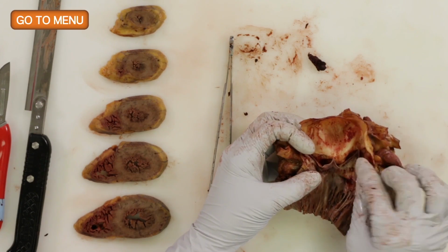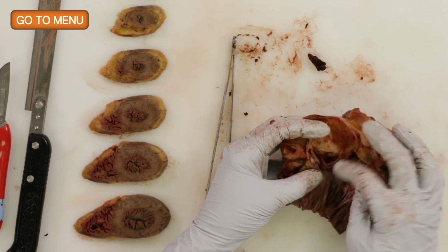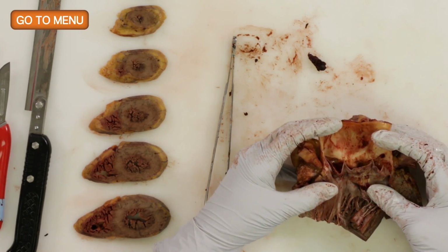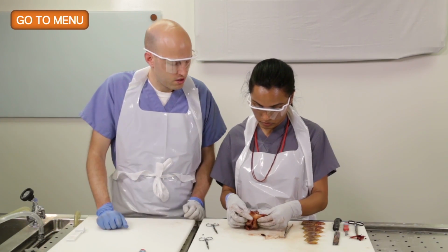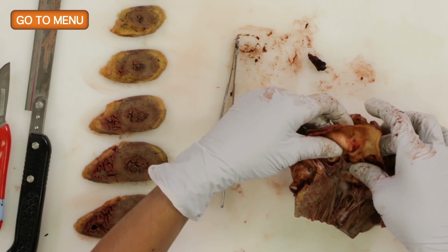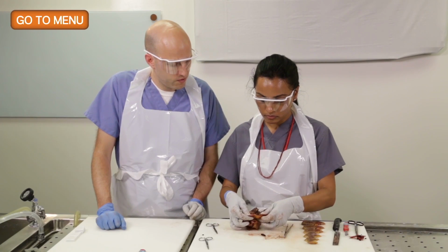3 cusps. You can see the ostia as well. It's where we took the arteries out of. Right. And so let's measure it. 6.5 centimeters. Maybe there's some calcification in here. Some mild calcification. Okay. All right. So the cutting is done.